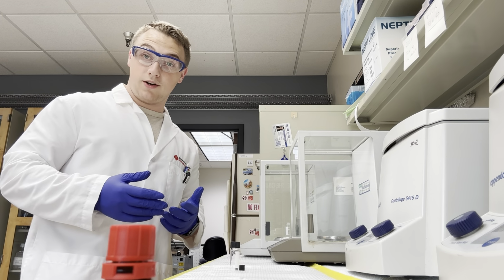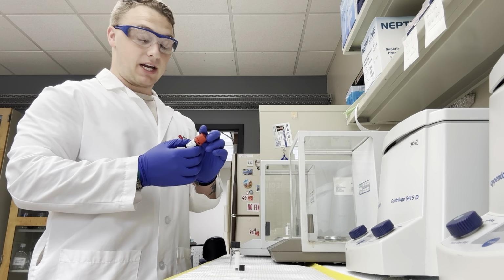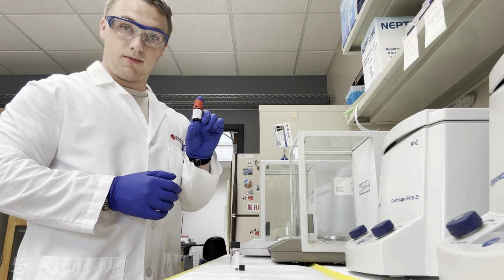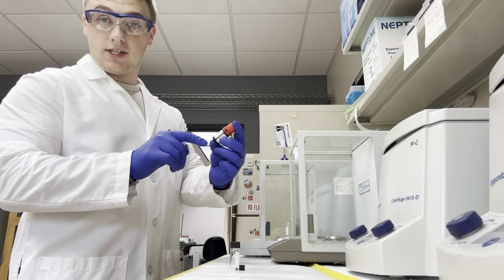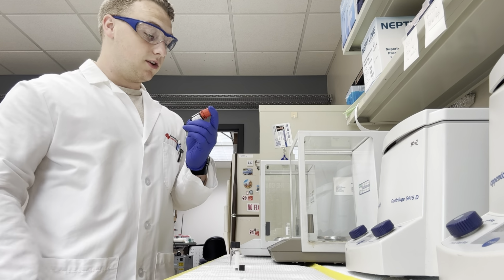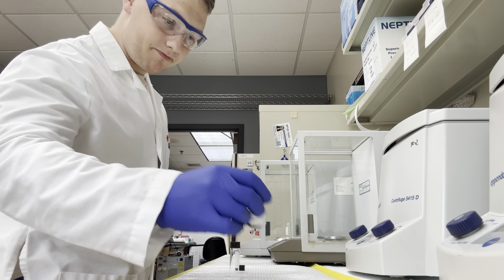So the first thing we want to do is obviously get the sample we want to dilute. Like I was saying, this is a Nile red solution, and when we have these samples in their stock containers, we want to mark the date they were received and the date that they're going to be opened. So that would be today. They were received, it looks like, on June 20th of this year, so not too long ago.